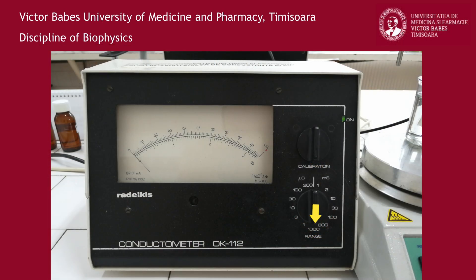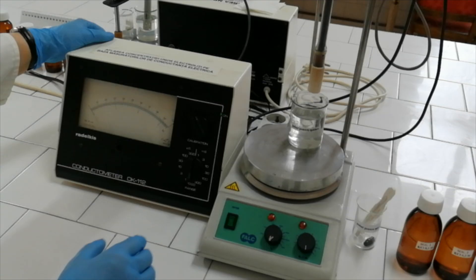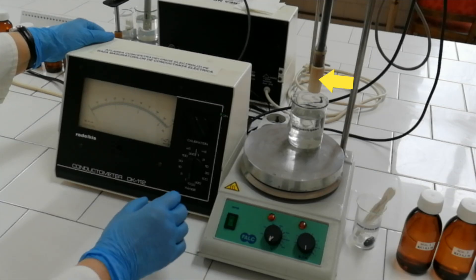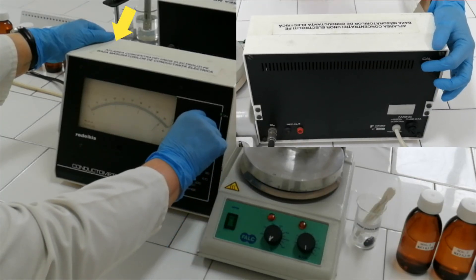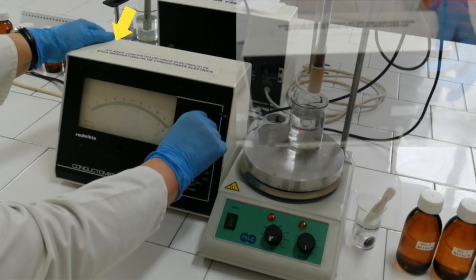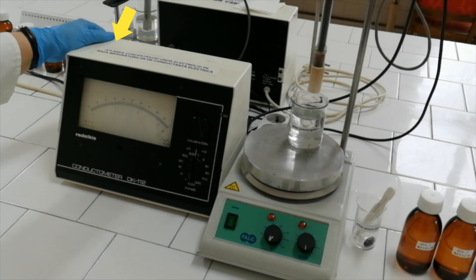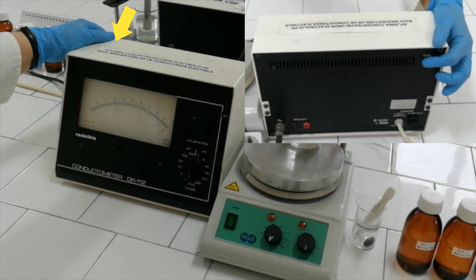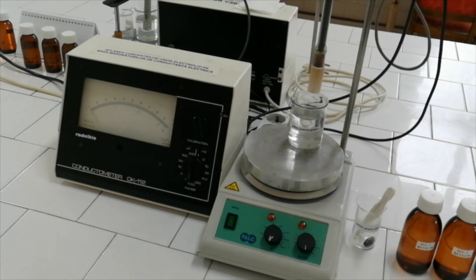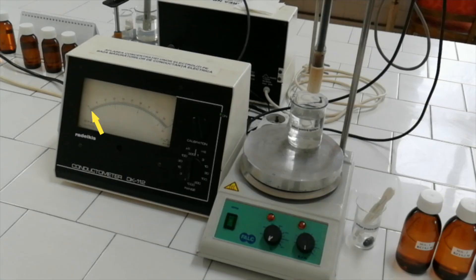Set the 1000 mS measuring range. With the measuring electrode in air, push and keep pressed the calibration button on the back panel. Rotate the calibration knob until the indicator overlaps with the red triangle mark on the display. Release the button on the back panel. The indication needle should return to the zero position.